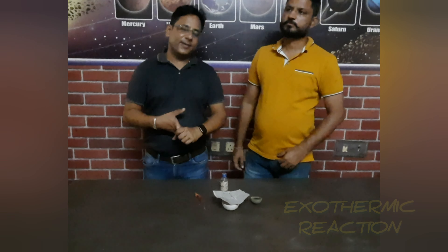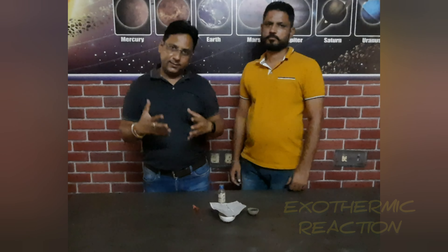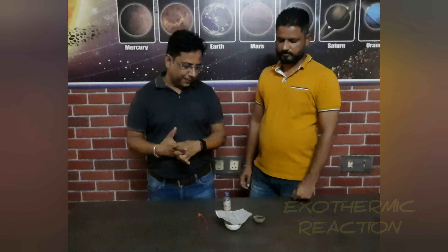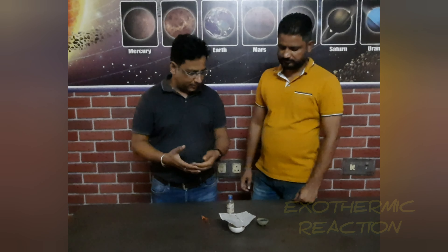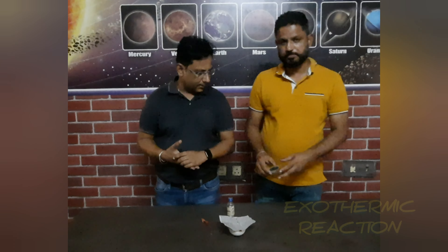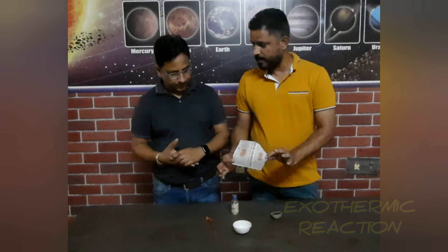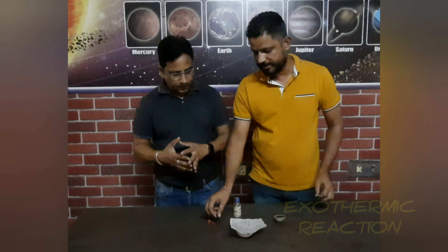Hello students and respected teachers. Welcome back to this video. Today we have a very interesting activity in front of you. Today we have potassium permanganate and glycerin. We have a simple beaker and a dropper.